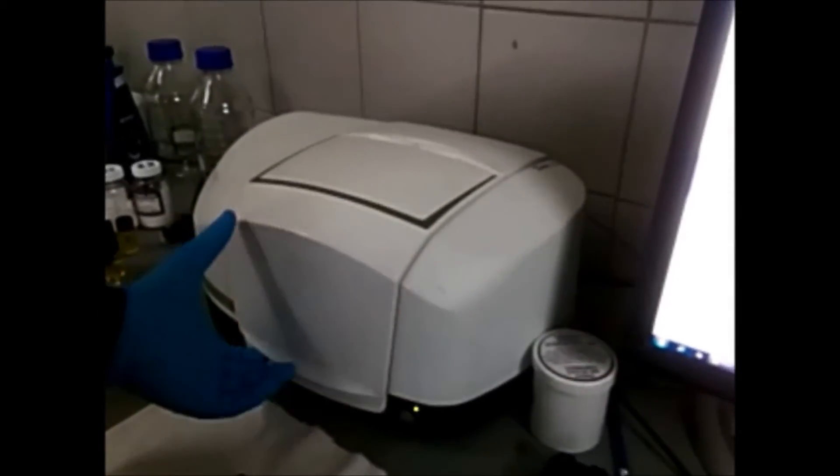Before you take an FTIR, this sample holder place is empty. You have to take the background scan of the empty sample holder.